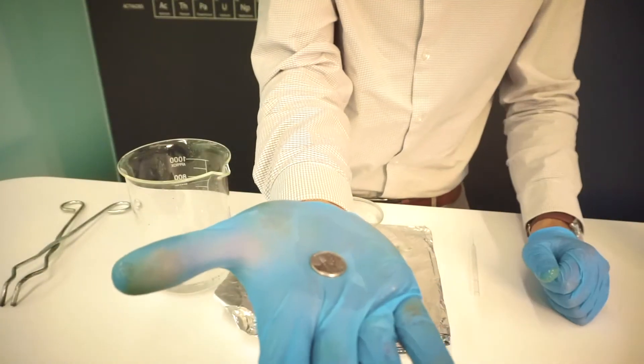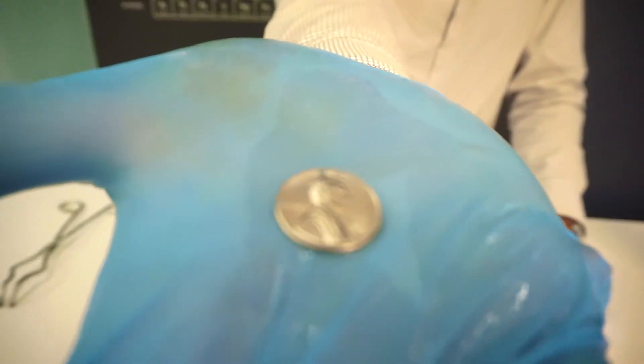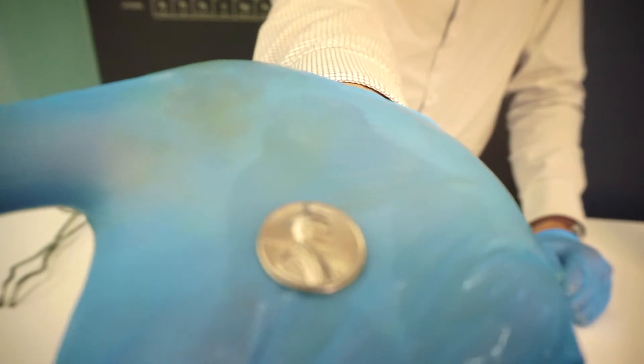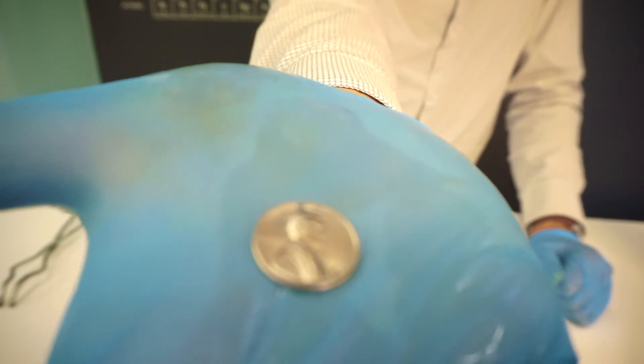So you can see the color has changed. It's a little bit silvery. That's because the zinc has plated on the copper.